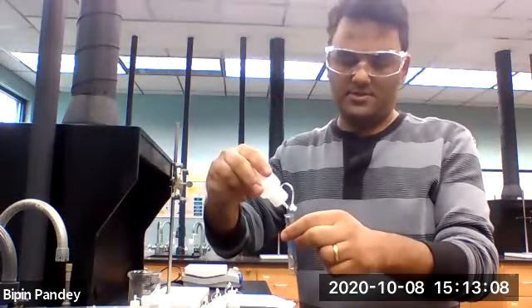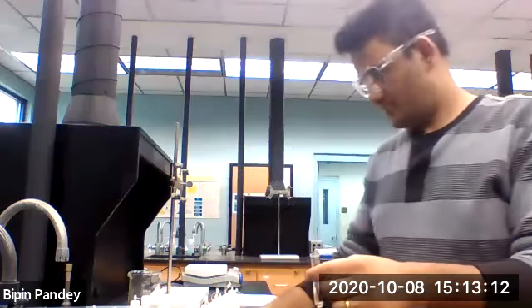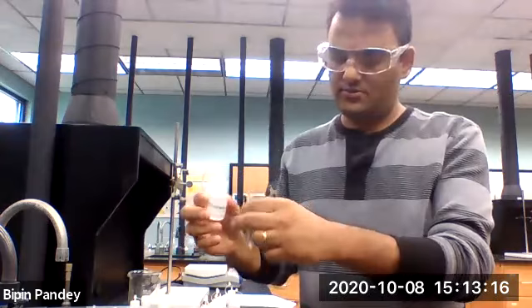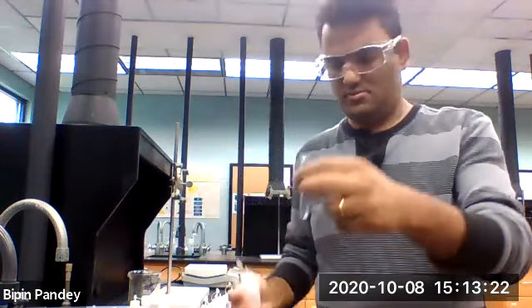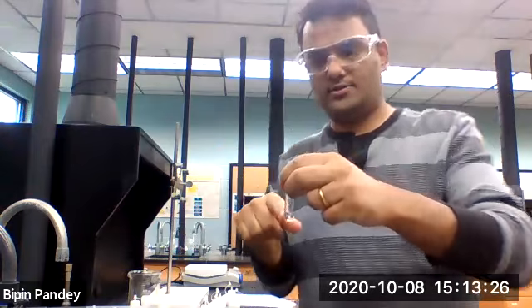Five drops of potassium chloride, add phosphate next, sodium phosphate. Solution stays clear, no reaction.